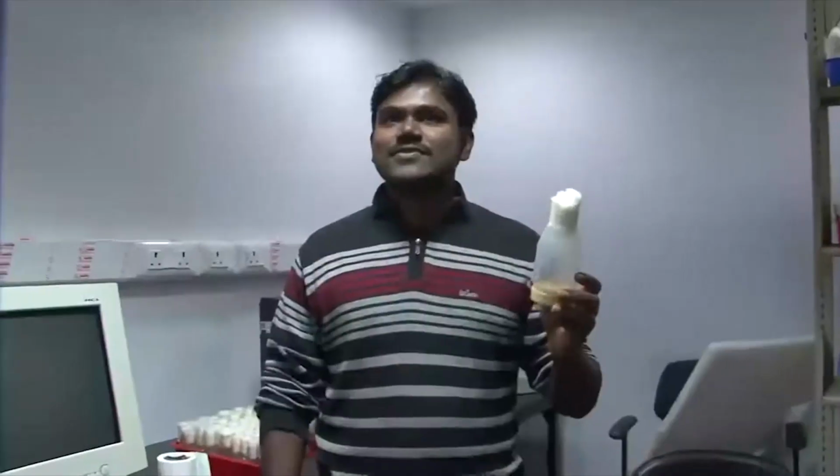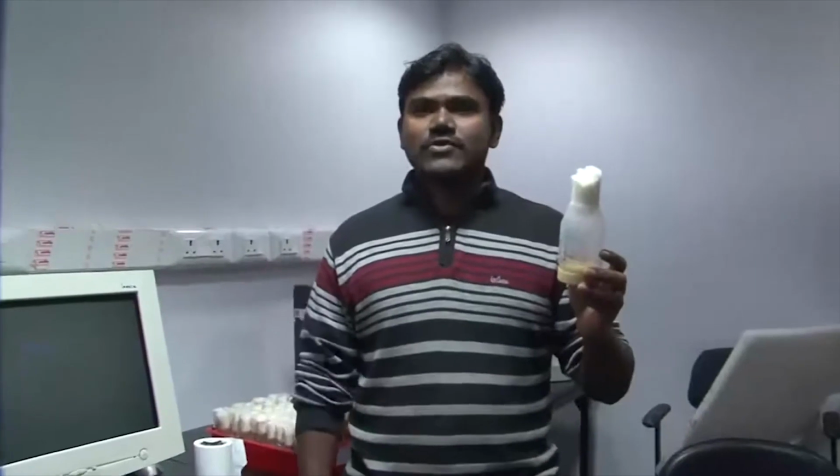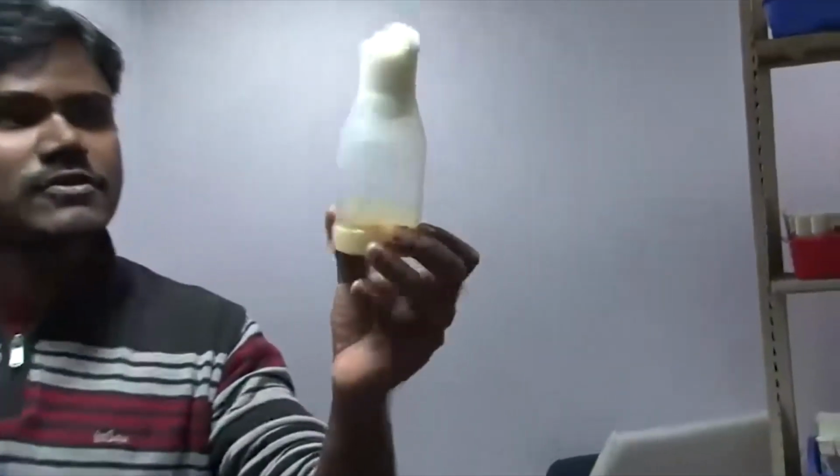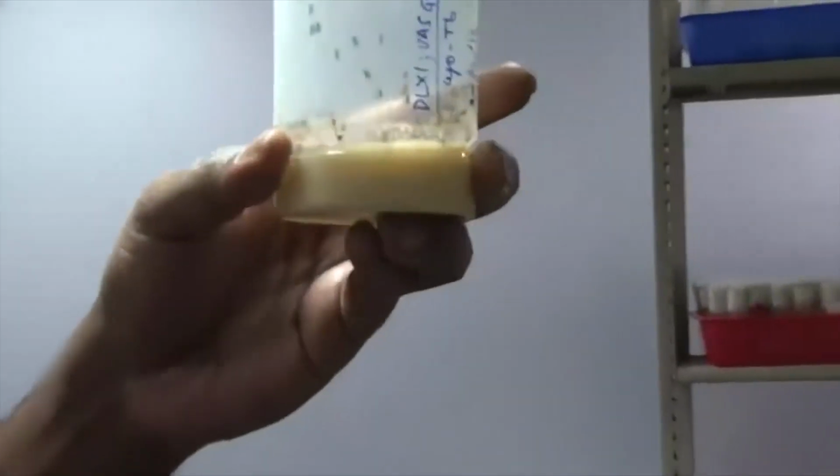Thank you. This is a room to maintain Drosophila stocks, and the room temperature is maintained at 18 degrees Celsius. Drosophila is a cold-blooded animal, but the temperature for their viable conditions is 18 to 25 degrees Celsius. It will not be either below 18 or above 25. This is one of the flasks of Drosophila flies that are climbing.